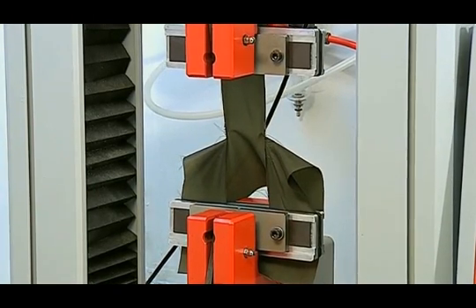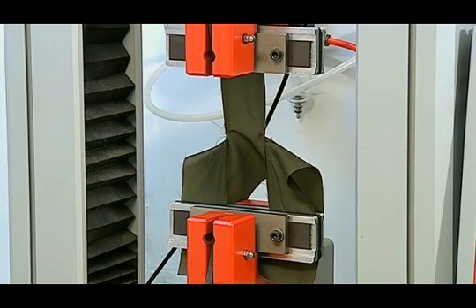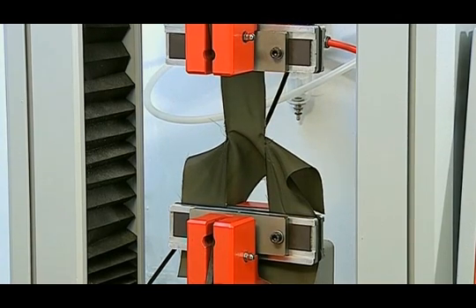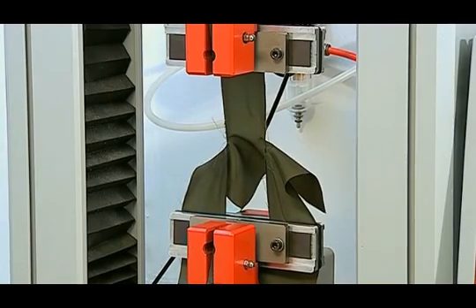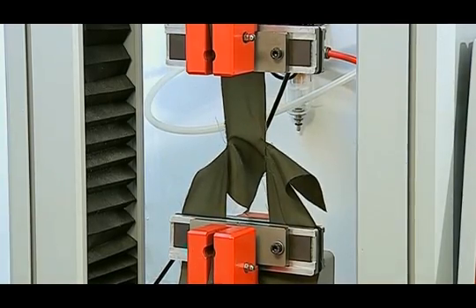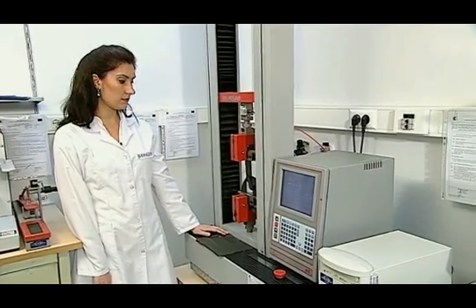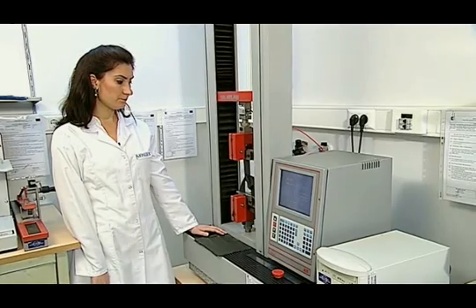It must be made sure that jaws are not dislocated during the test, and shearing must be done in a linear manner. Test results are not taken into account if this does not happen, that is, if the shearing is not linear and if the jaws drift away.